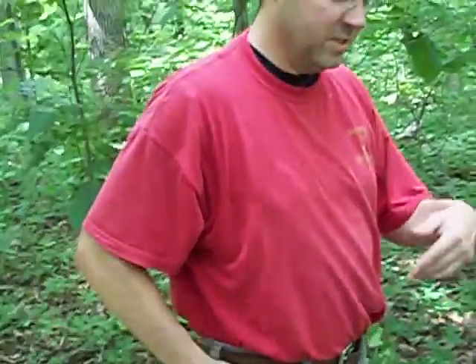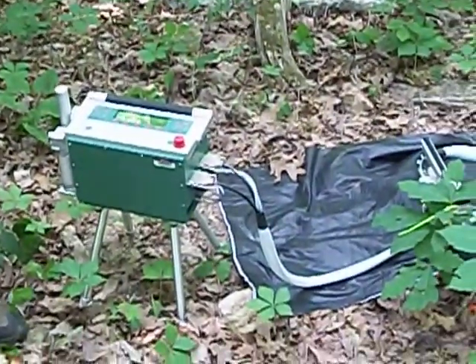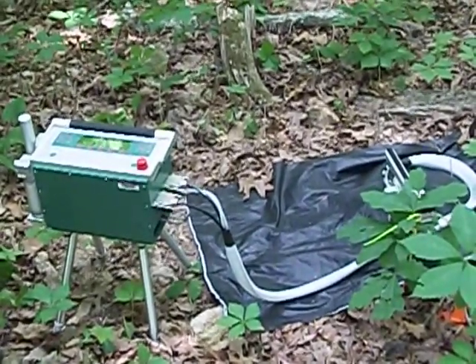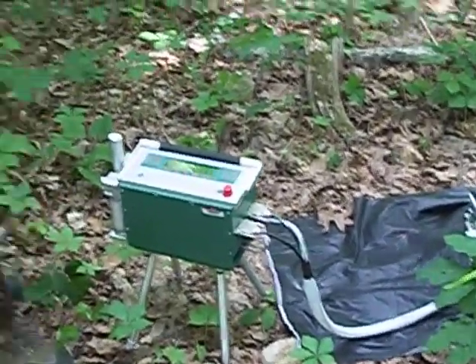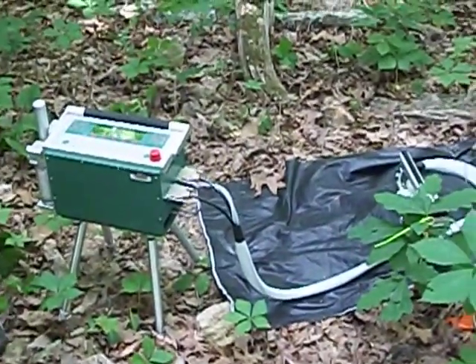We can do that for different species, and we can draw conclusions about how well each species of plant grows in a particular light environment, or a particular soil moisture environment, or a combination of factors. So basically, it's bringing some high technology to an old field of forestry. $40,000 a pop. It is high technology, y'all.